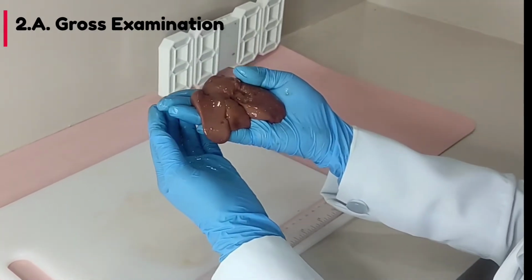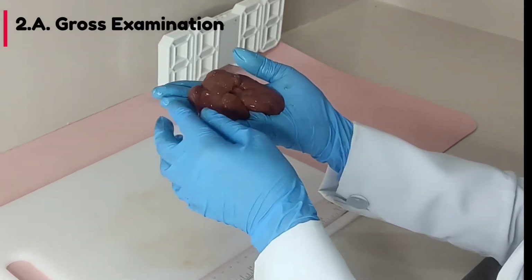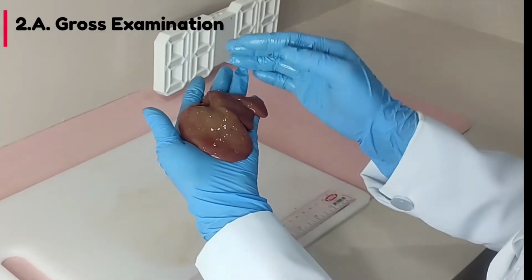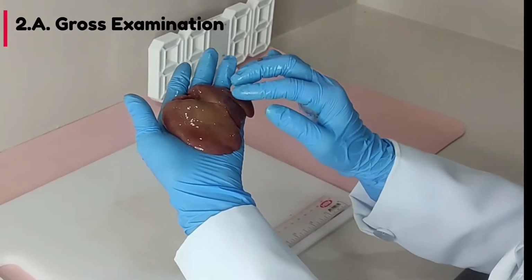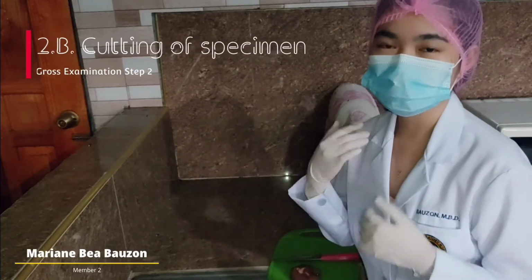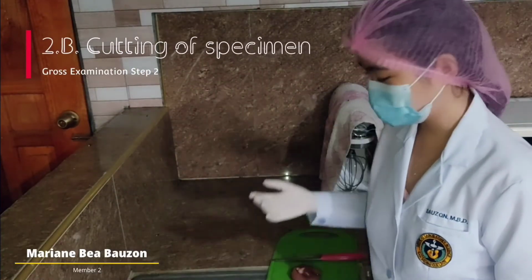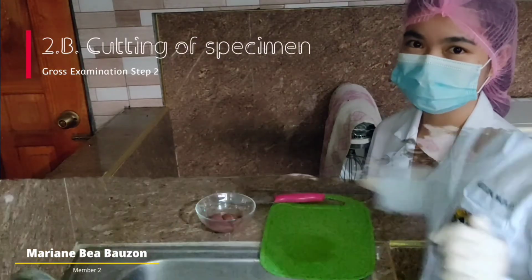No gross fibrosis or gross calcification noted in all areas. The color of the specimen is tan red to brown. The shape is wedge, and the consistency is soft. As of this moment, I will be cutting transverse and cross-section to obtain a representative tissue for thorough examination.